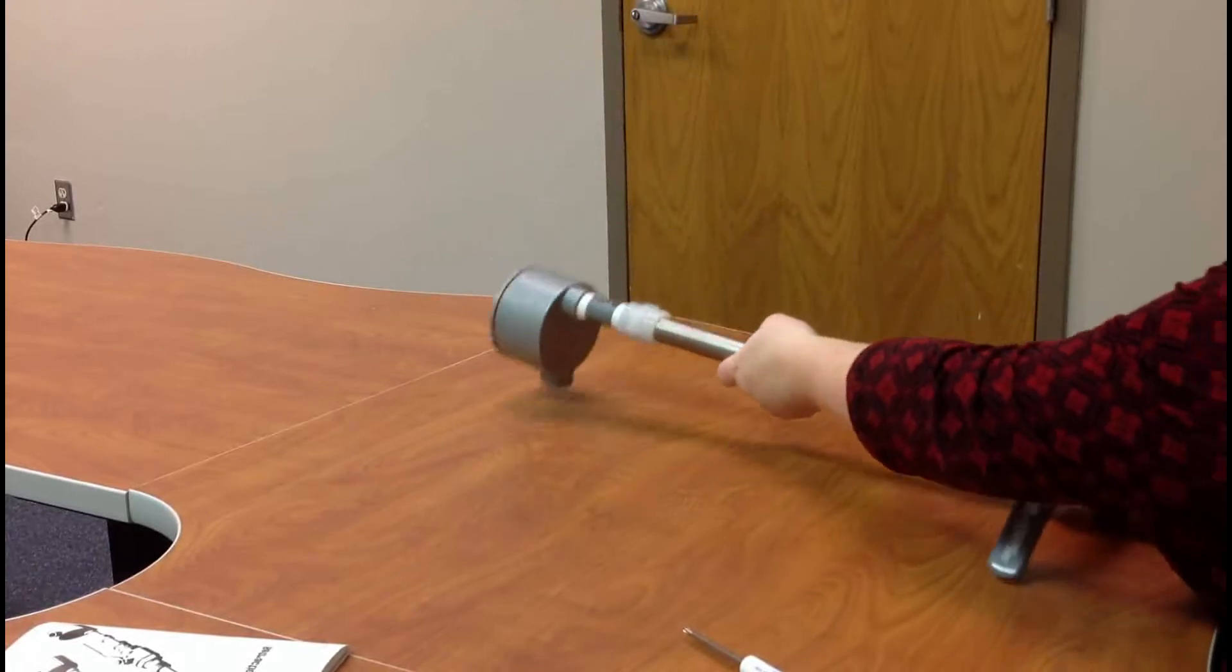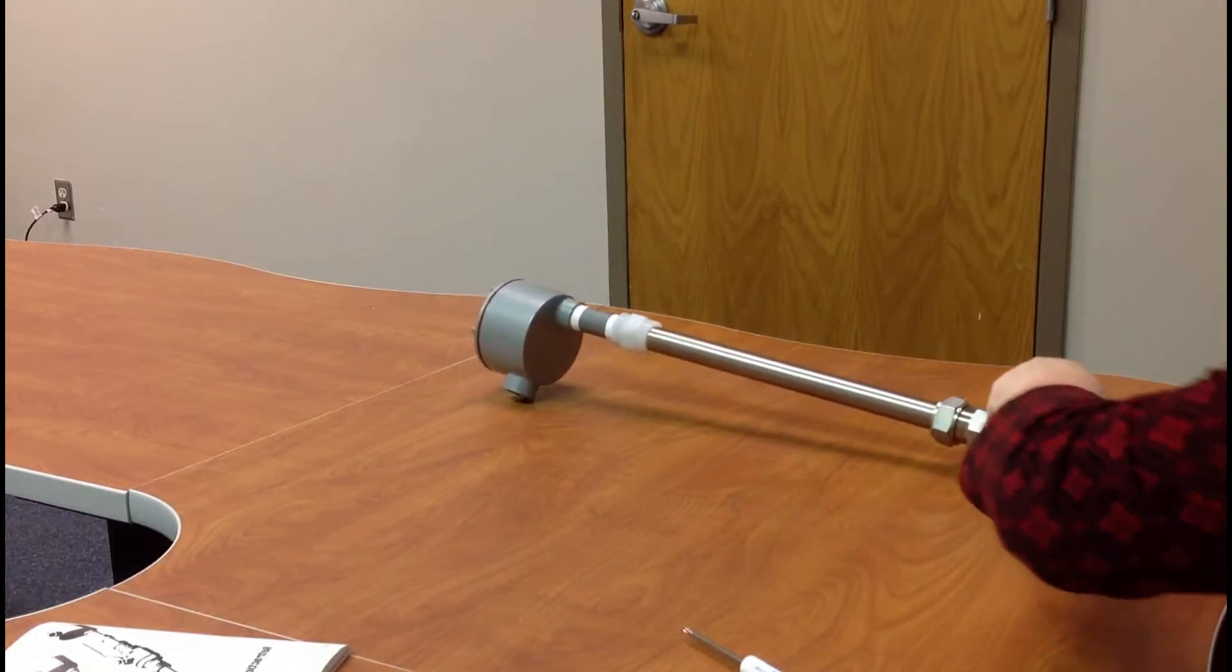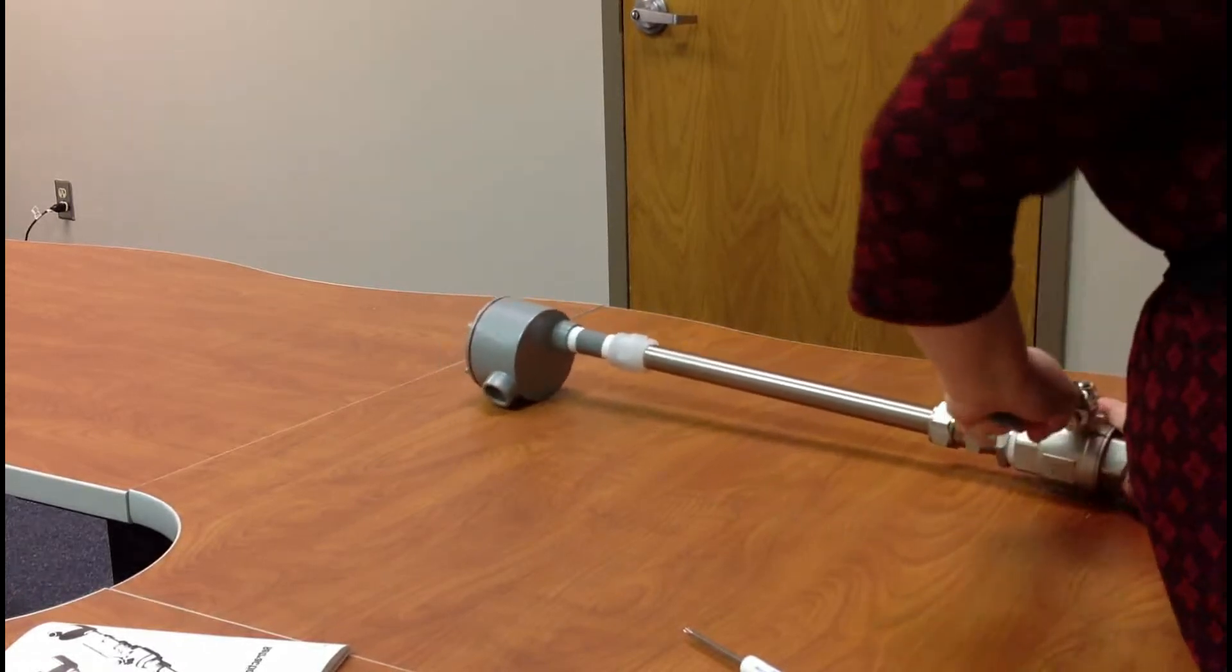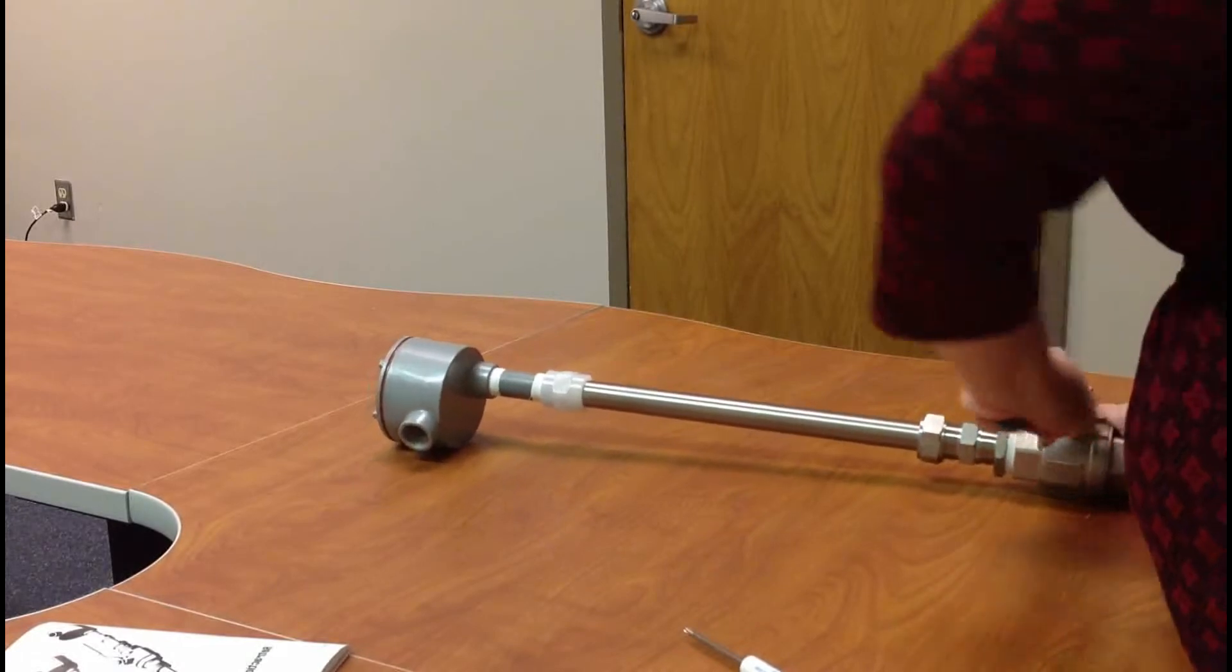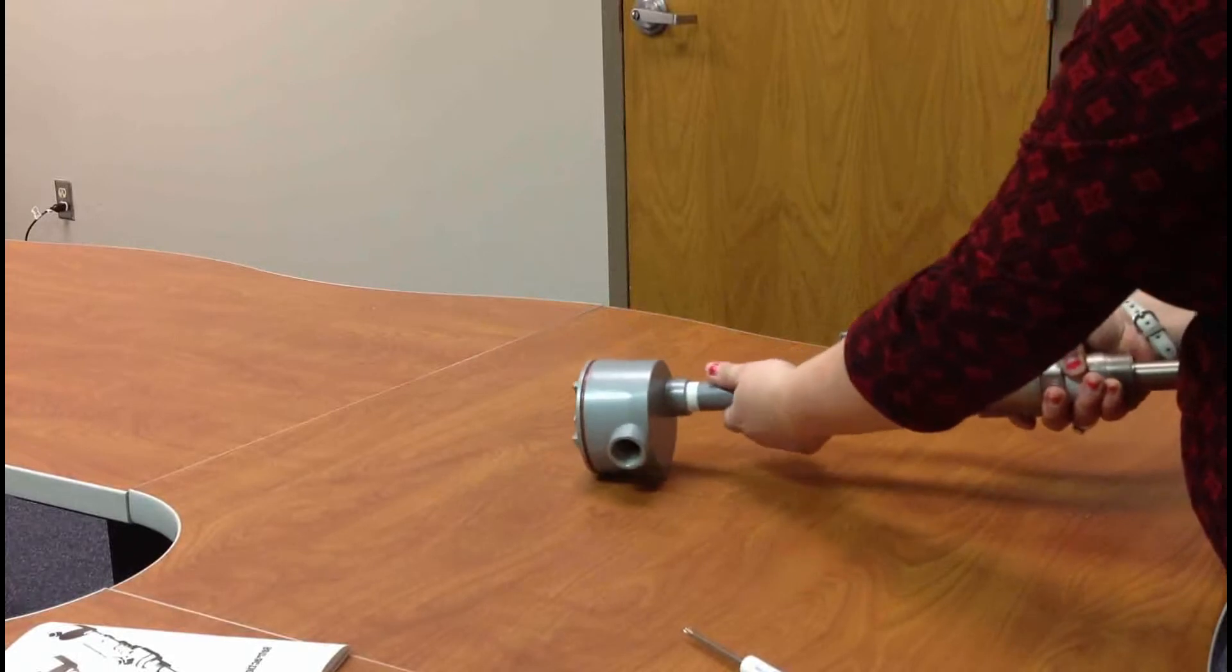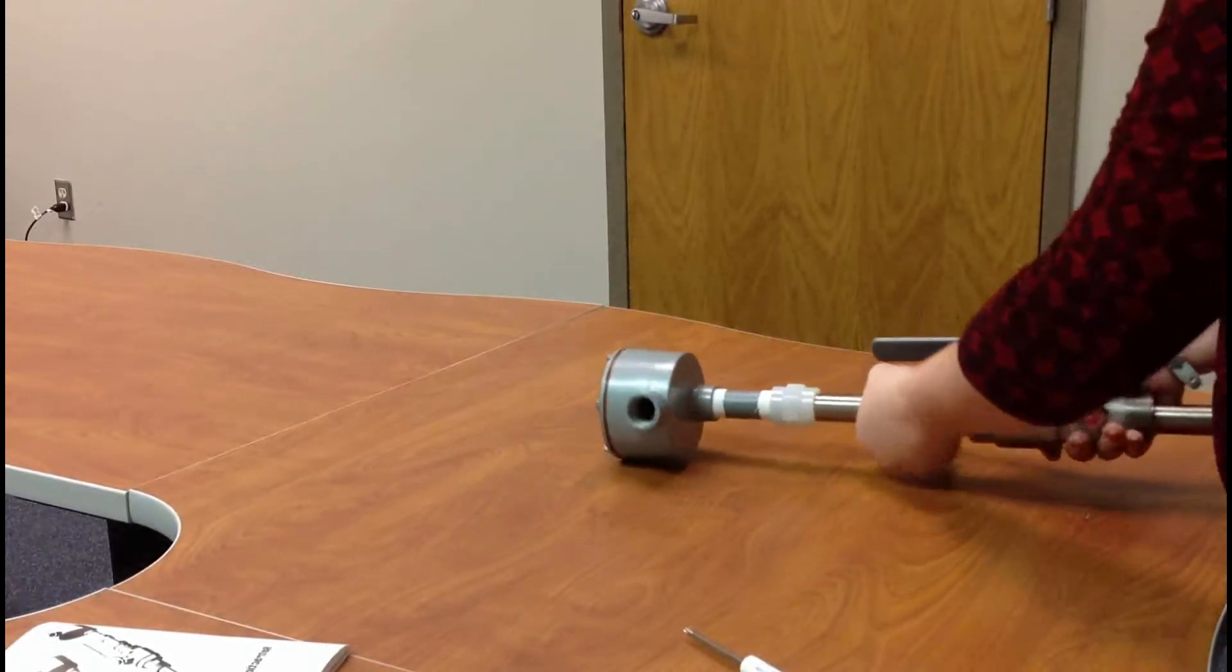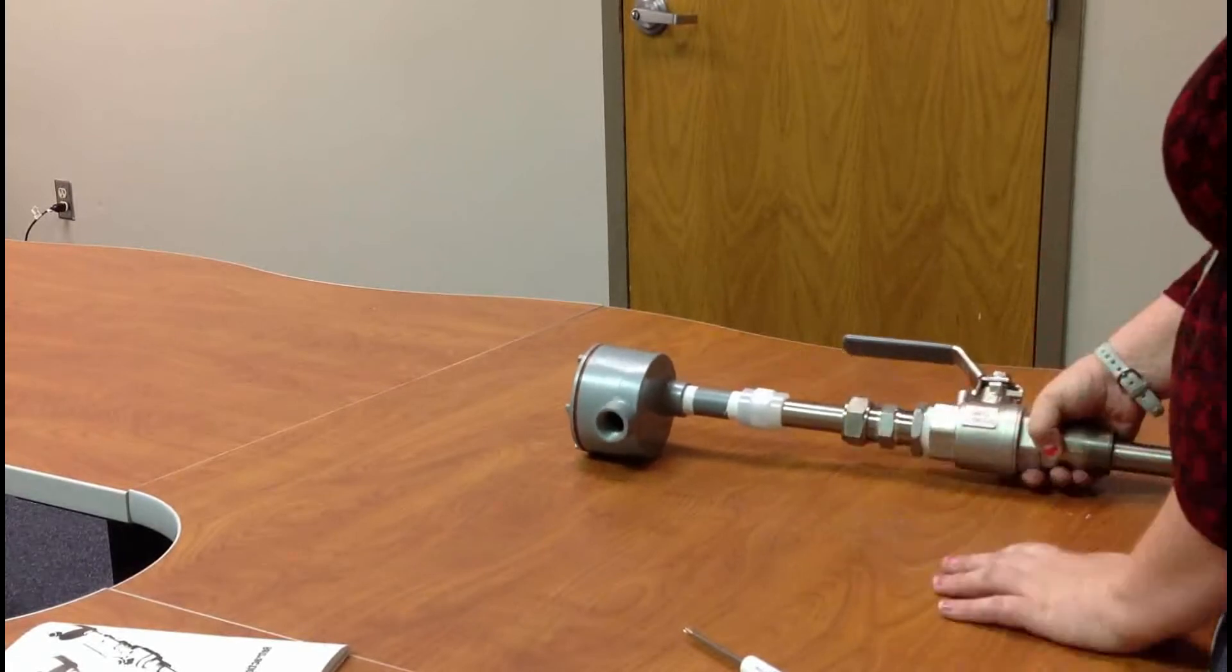Then once it's snug and fine, keep it tight. You will then open your ball valve, and then you can slide the retractable to whatever insertion length you want, and then tighten the swage fitting, crimp it down so it's in one piece.